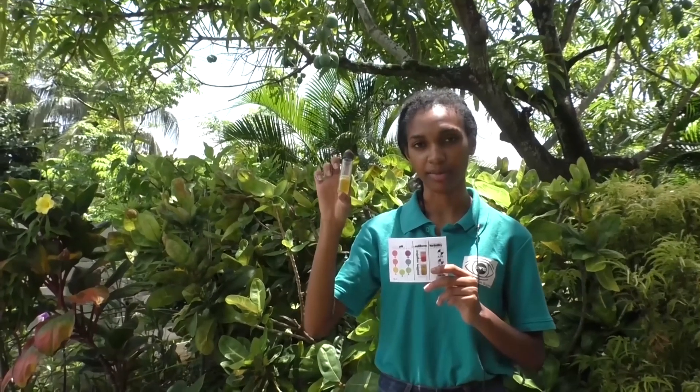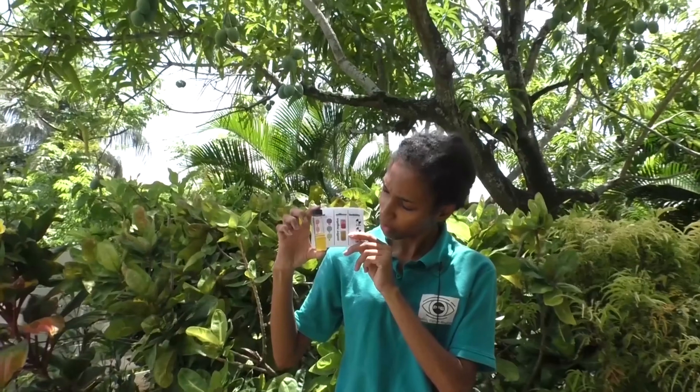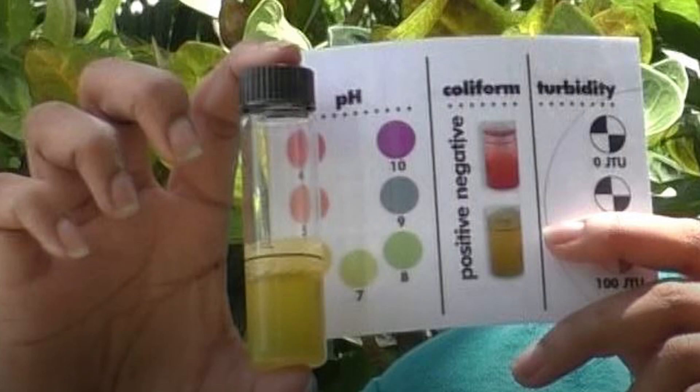I now have my results and I'm comparing them to the chart. It is definitely yellow, which means the result is positive for coliform bacteria. According to the water manual, a positive result shows: many gas bubbles present, gel rising to the surface, liquid below the gel is very cloudy, and the indicator turns yellow — all of which are clearly visible in this test tube.